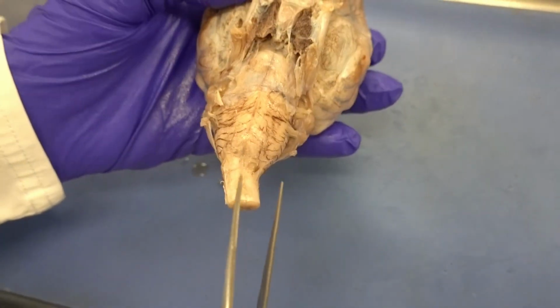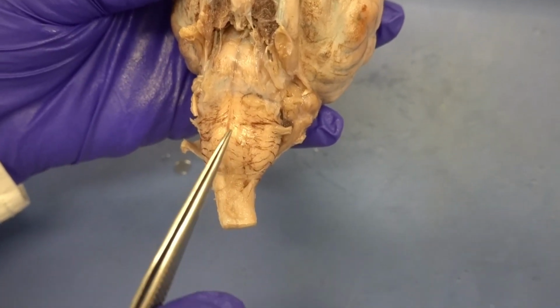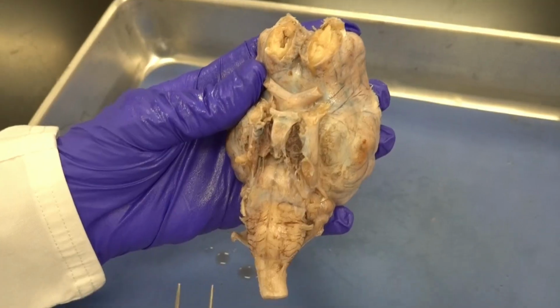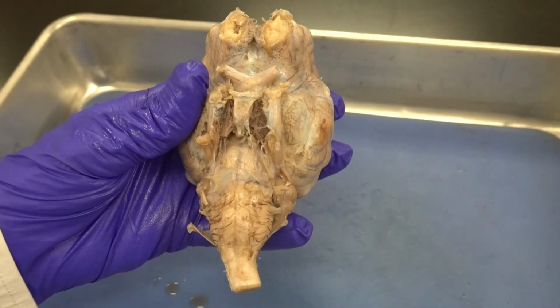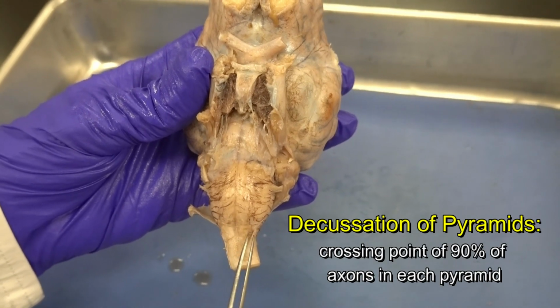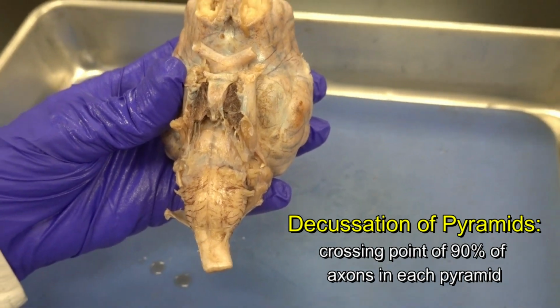And please keep in mind, when we get here, exactly above where medulla oblongata fuses to spinal cord, 90% of each corticospinal fiber tract crosses and moves to the opposite side. That explains why each side of the brain controls the movement of the opposite side of the body. And we name that place, where 90% of each corticospinal fiber tract crosses and goes to the opposite side, the decussation of pyramids. So that's something interesting to know about medulla oblongata.